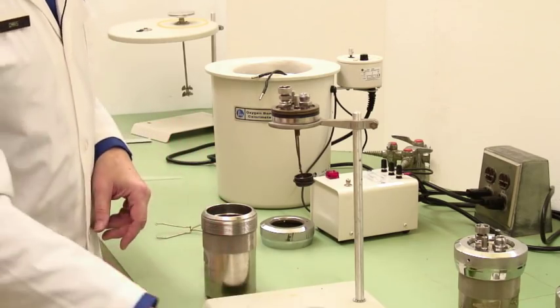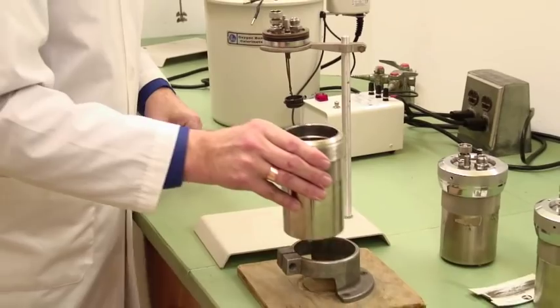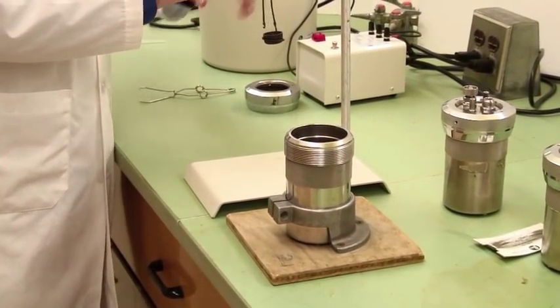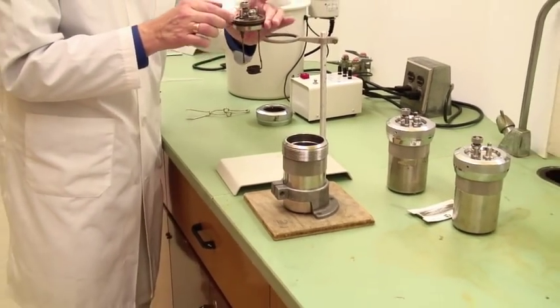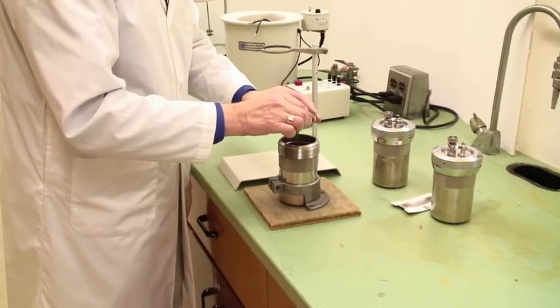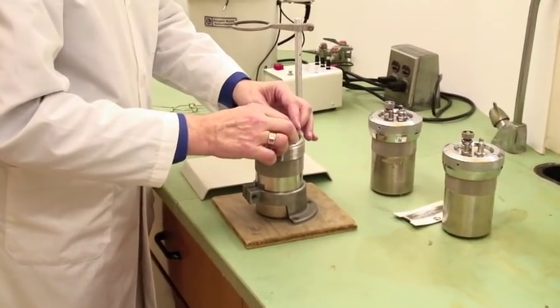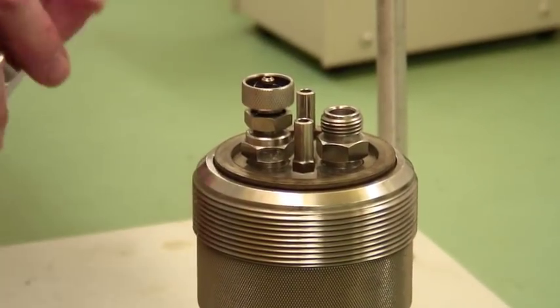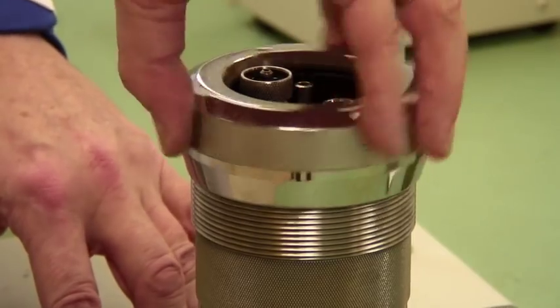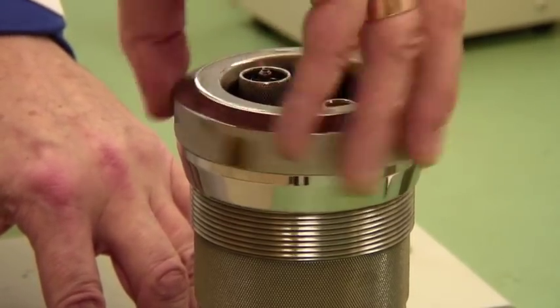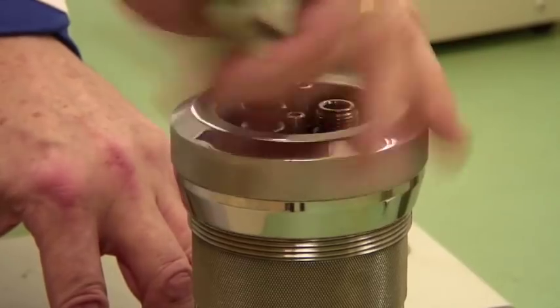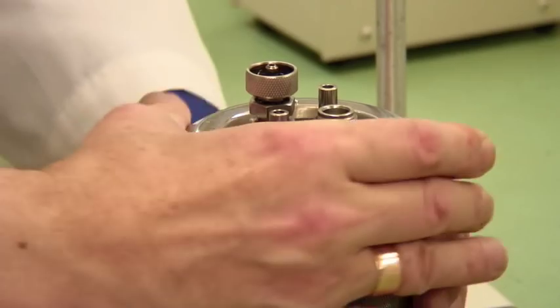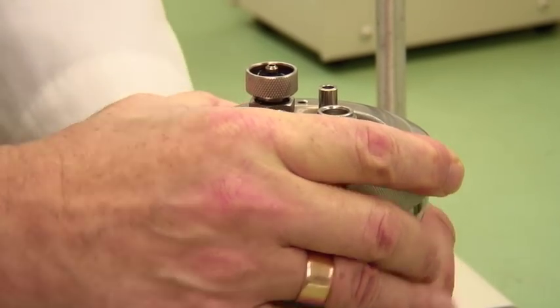Then if you put this into the high-tech holding bracket which will hold it firm, take the bomb head, be reasonably careful here. It fits very snugly into the lid. Push that down with your fingers, and then the locking ring goes on the outside. That twists all the way down. You do this until it's finger tight. You don't need to be jamming anything, you don't need a wrench for anything, but do it reasonably finger tight.